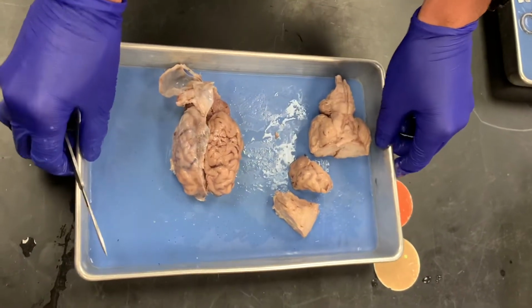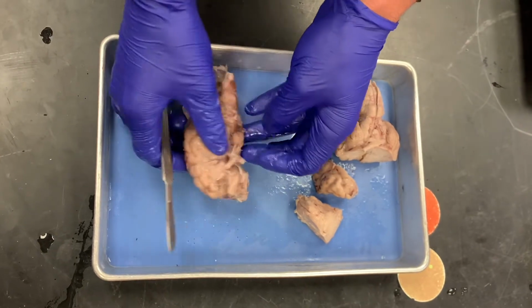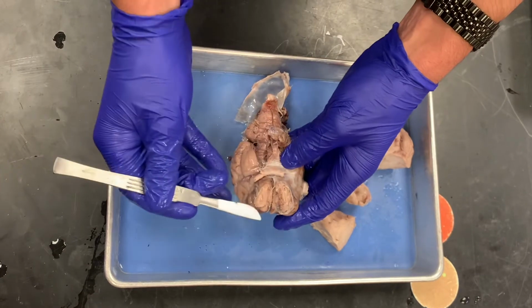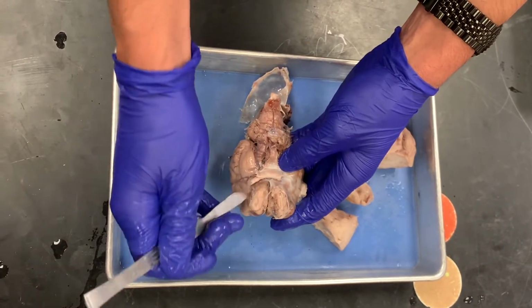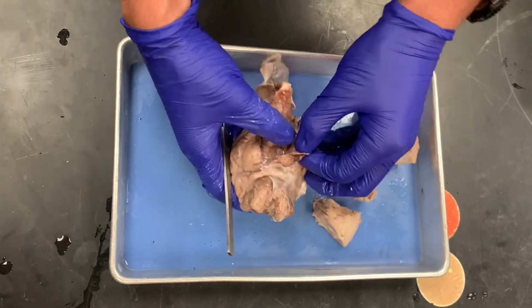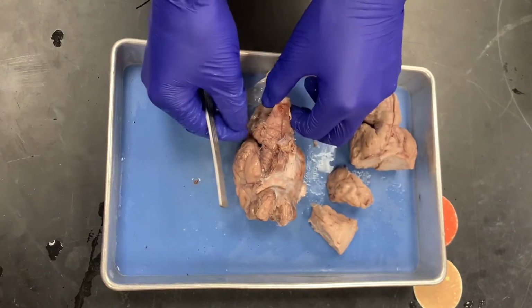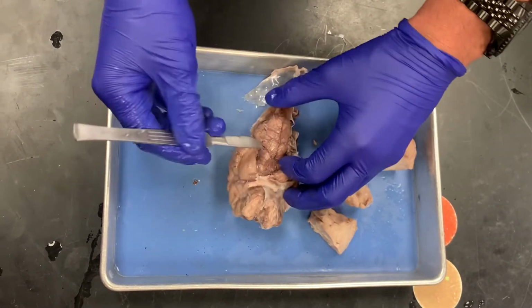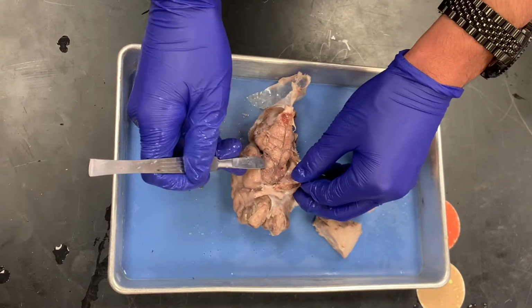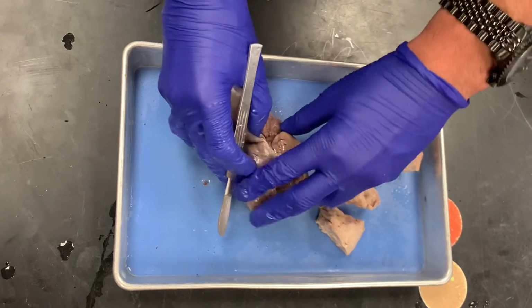Okay, so in this video we're going to go over all the different brain structures on this brain dissection. So the first thing I want to point out, this is the ventral part of the brain, so then you can see cranial nerve 1, the olfactory, you can see the optic nerve there. You can also see all the different lobes, right? So temporal lobe would be here, frontal lobe would be there. This is where the pons would be, the medulla would be here, and then the midbrain is in this area here, and it wraps around on this side.